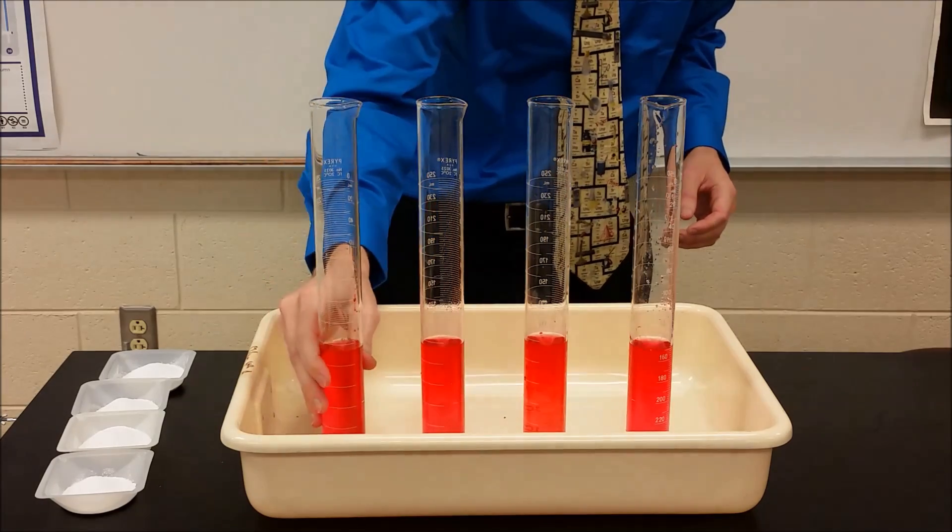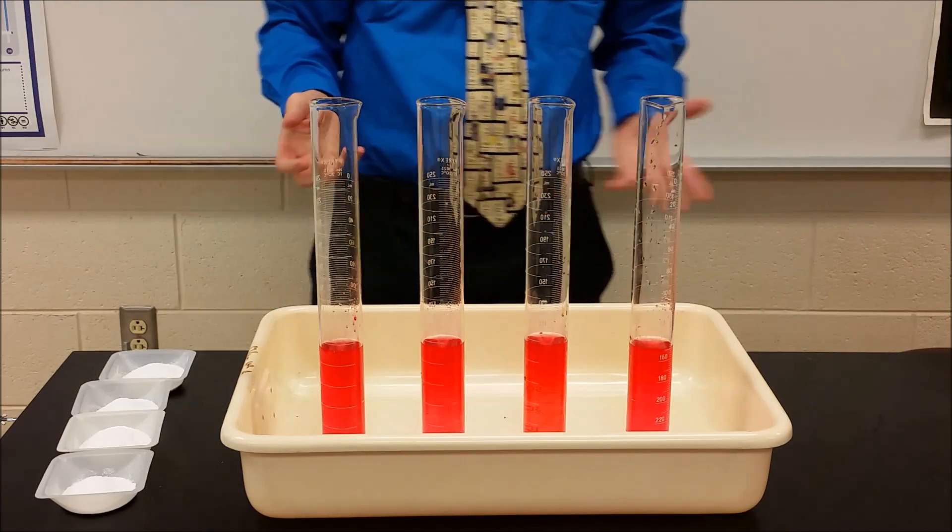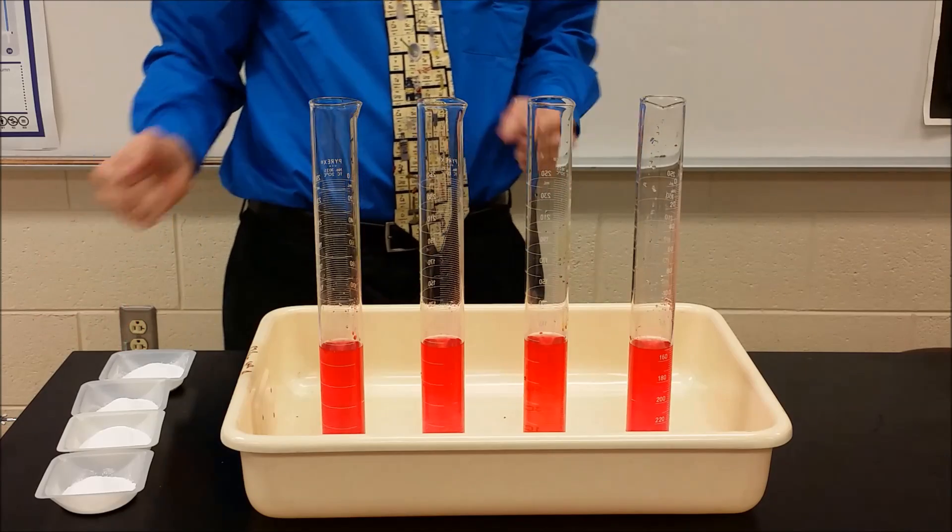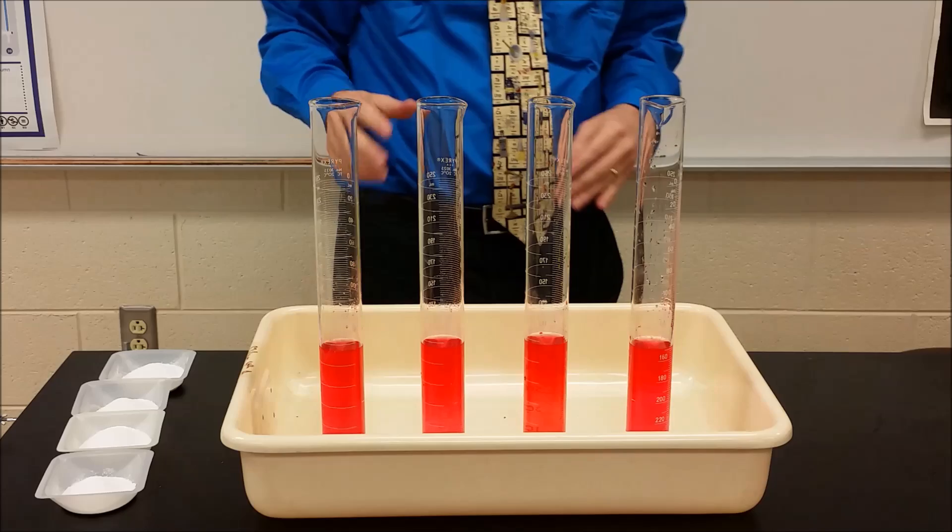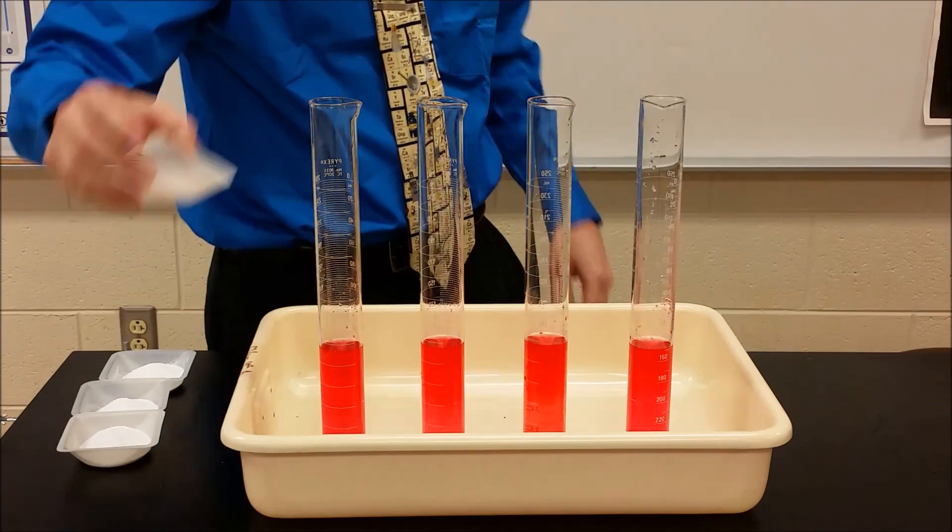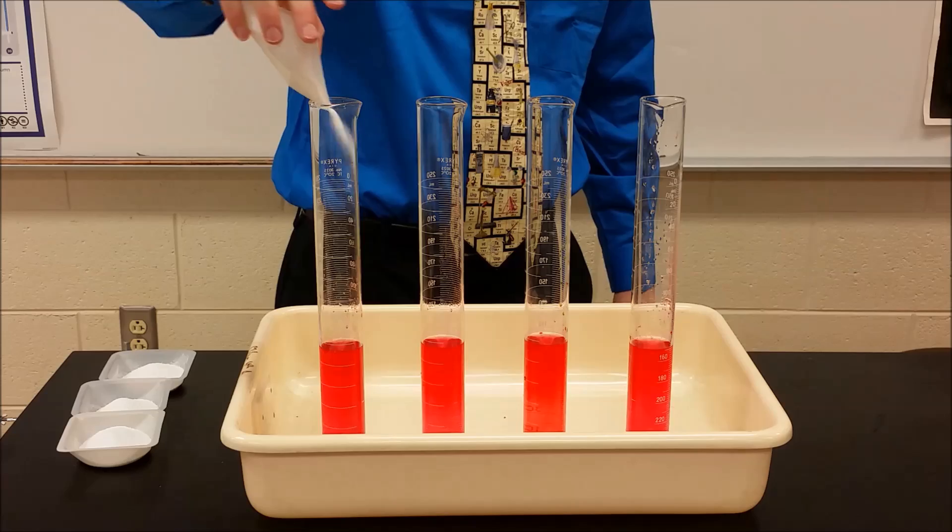So to add a little bit of observation and evidence to this, I've put out a set of four approximately equal amounts of sodium carbonate. We're going to add them to each one to compare what the difference is between these four.